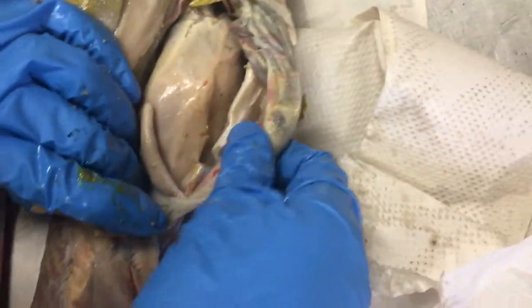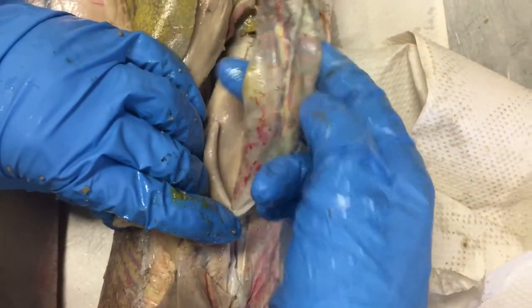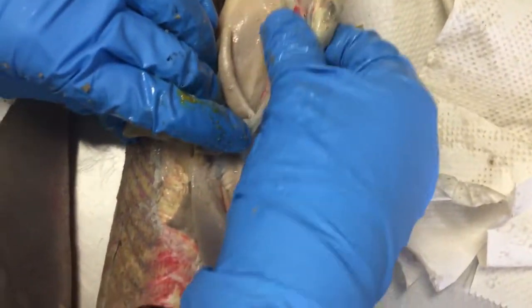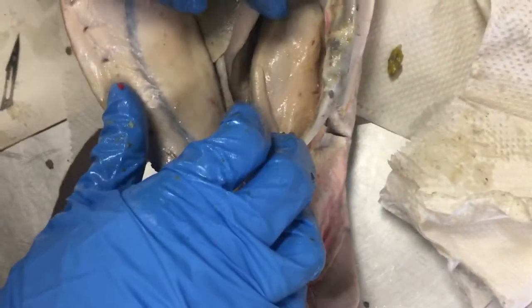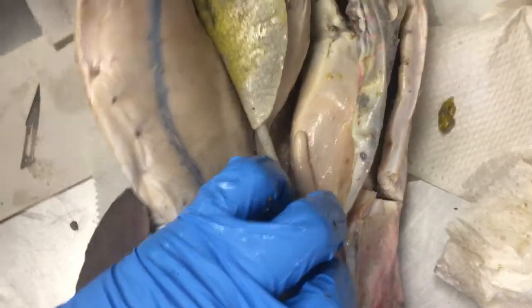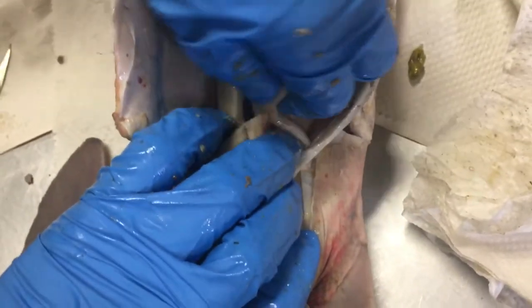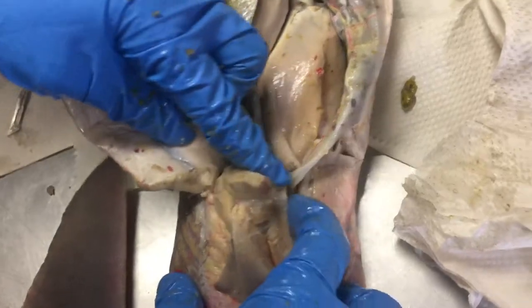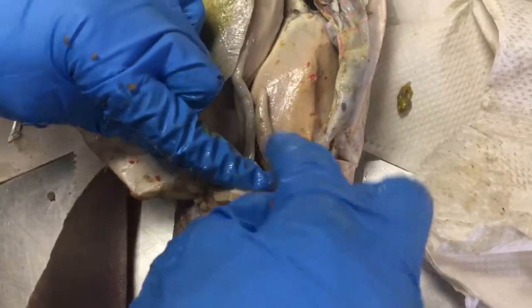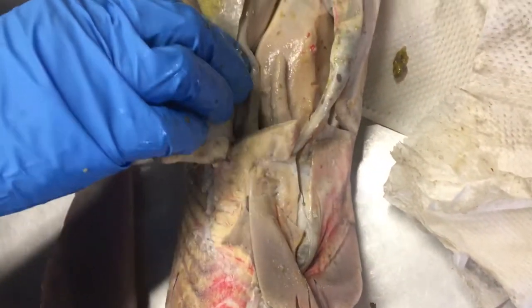Then we have the colon, which is this little area down here after the ileum and the spiral valve — just this section before you get to the cloaca. The rectal gland is this little protrusion, a little nubbin from where the colon is, and it's close to the cloaca as well.